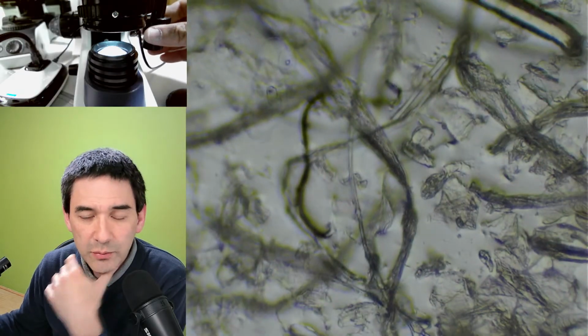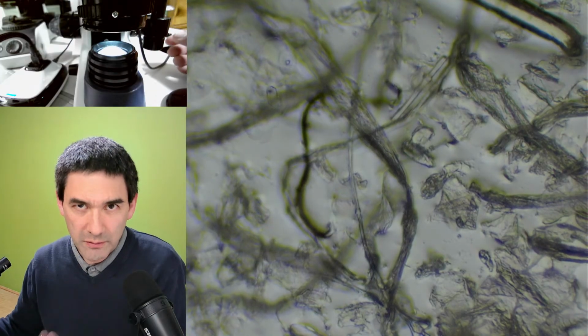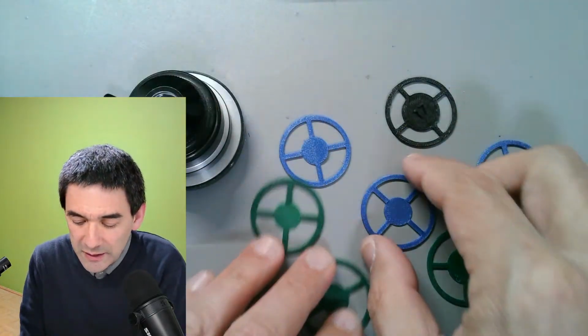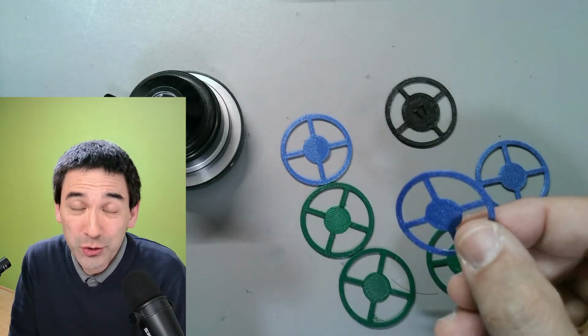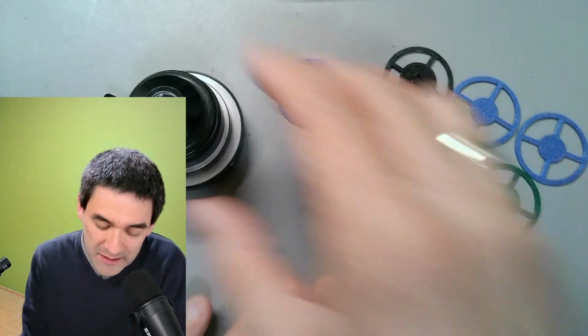So what I'm going to do is start with a little bit of theoretical background, and I'm going to very quickly move to the desk view because I would like to show you a little bit what I got here and why these filters look more like Rheinberg filters and dark field filters and not like the traditional oblique illumination filters. But let's start at the very beginning.